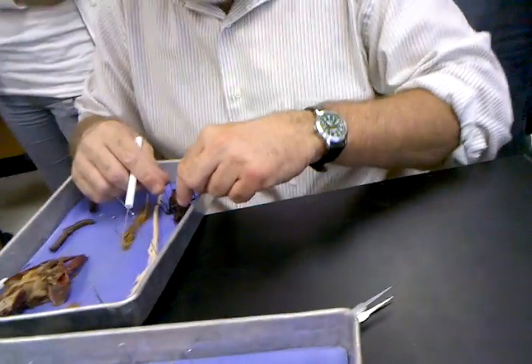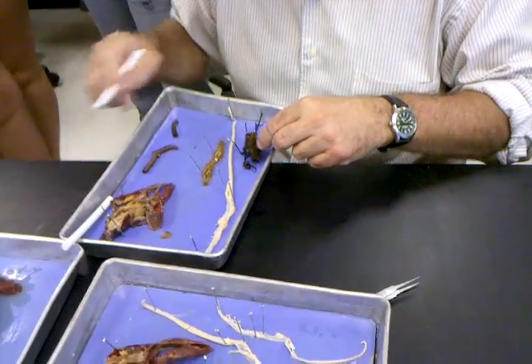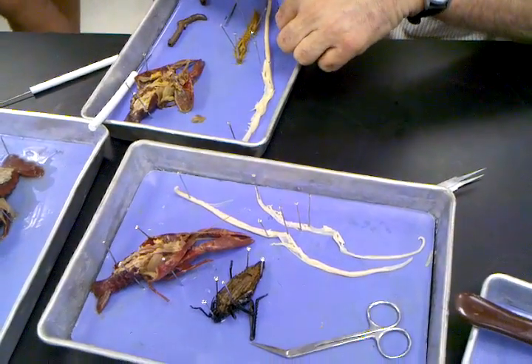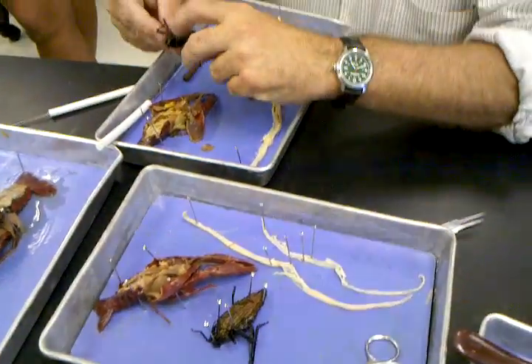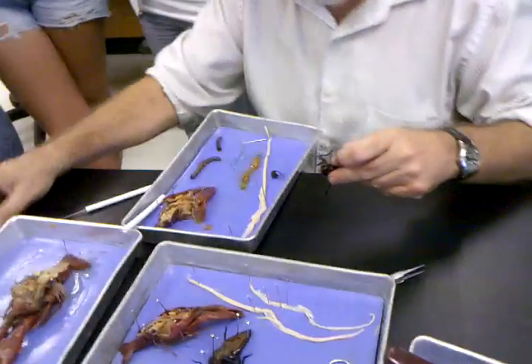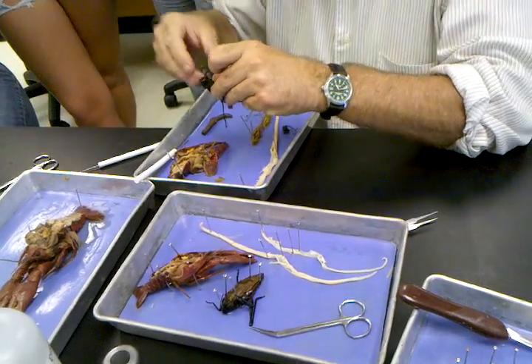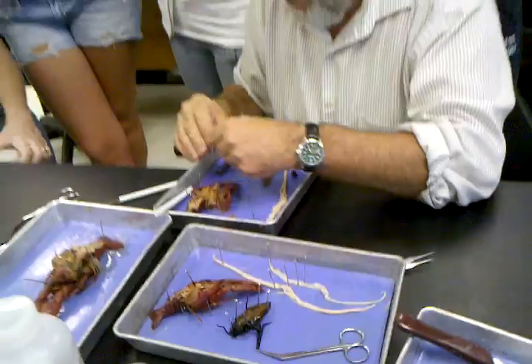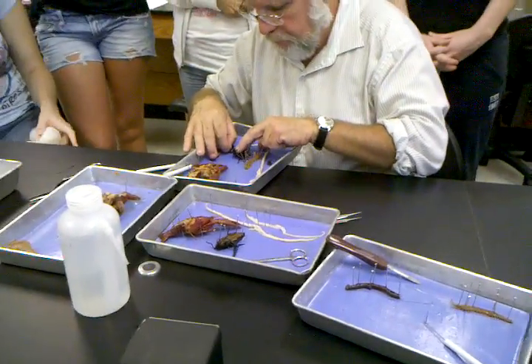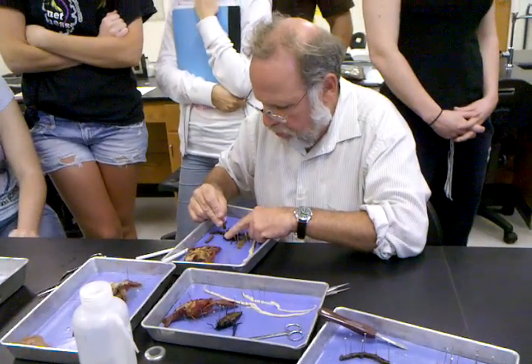A little bit slicker. Somebody decapitated that one. Is it Bill Long? He's done anyways. I was trying to do a bilateral symmetrical cut. Where are some scissors? He lost his head, Fred. At some sick level, this has actually worked out better without his head.